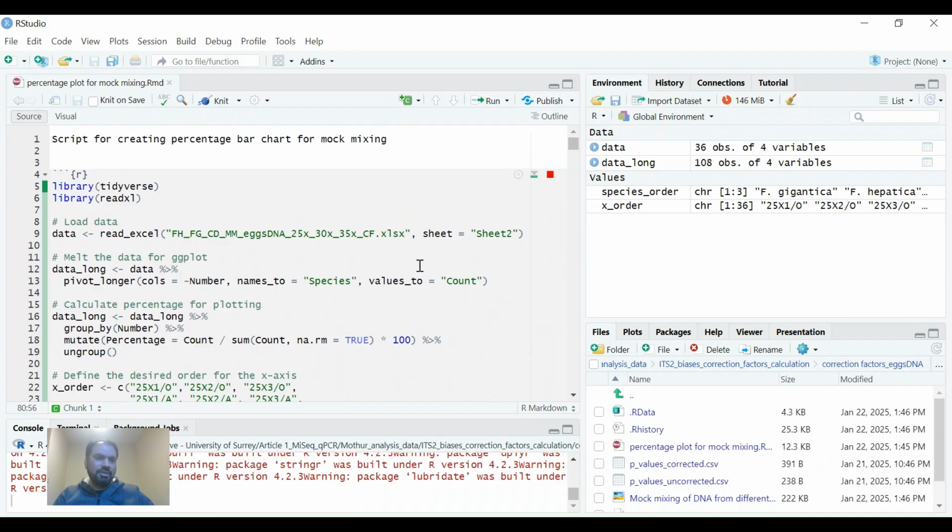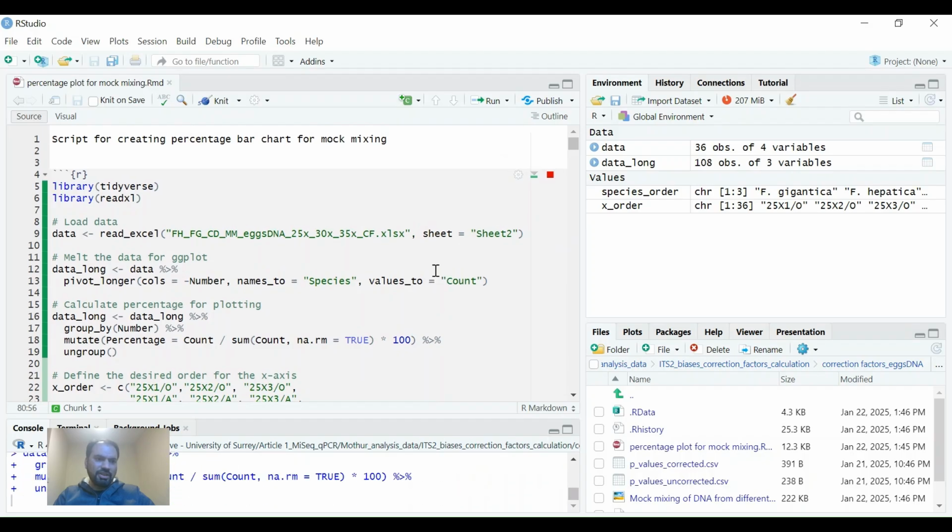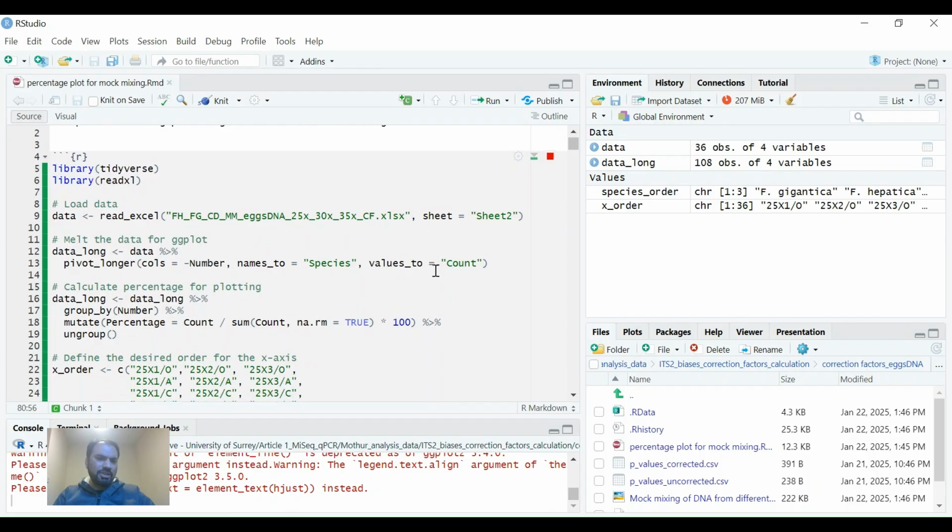It will run all the, oh, the sheet is running. We need to close the sheet first, and then we can rerun it because it will only run once the sheet is closed.